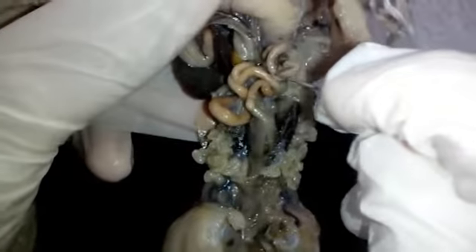Next is the small intestine, responsible for the absorption of digested nutrients. The first straight section of the small intestine is called the duodenum, and the curly part is called the ileum.